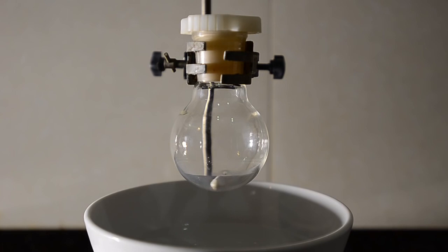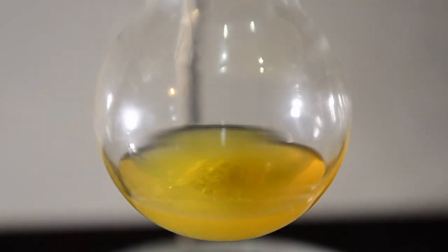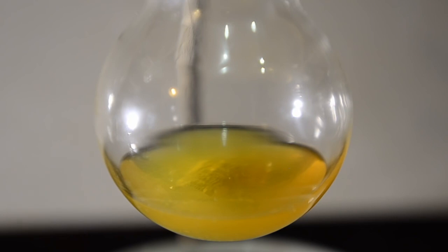This was an interesting experiment. It proves that if you have access to reagent quality ether and calcium chloride as a drying agent, there's no reason you can't perform a Grignard reaction. Having access to high quality magnesium is great but you can make do with low quality turnings provided you have some patience.